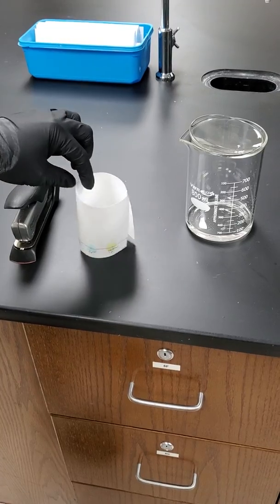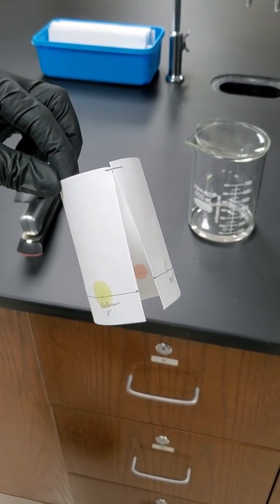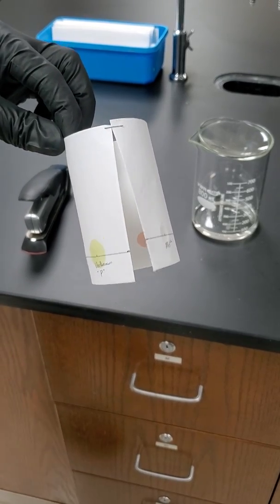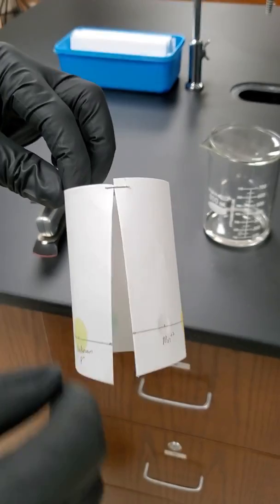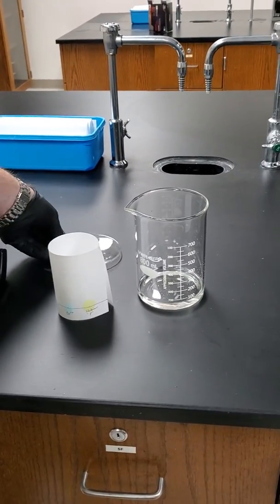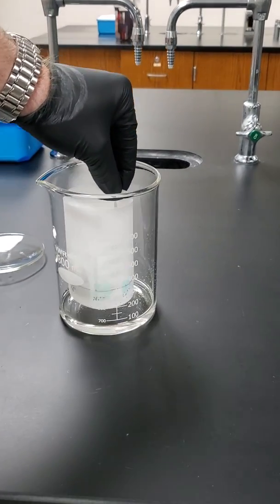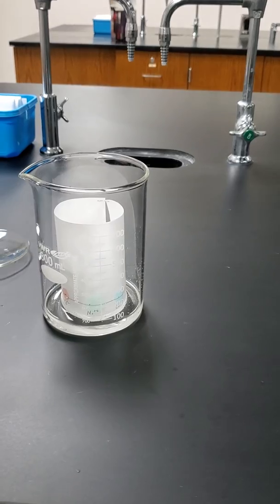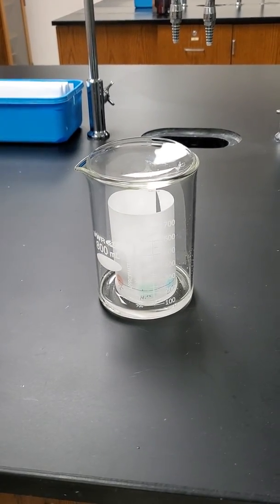So I've stapled my paper into a cylinder. Notice I didn't allow it to overlap because that would give it double the absorbency and those would cheat in their race. Also, we had the staple at the top because we're going to soak this in hydrochloric acid, which would eat the staple. Here's our liquid phase. This is our little motorcycle-like molecules that these transition metal ions are going to ride in, and we're going to let them soak for 45 minutes and see who wins the race.